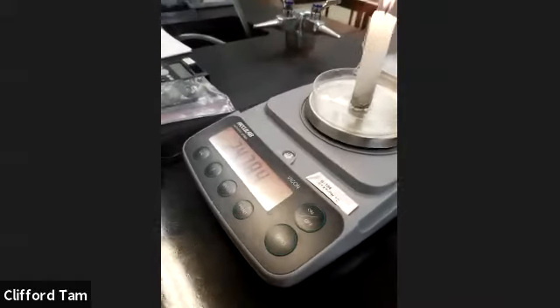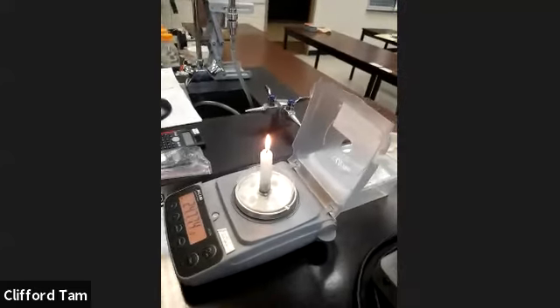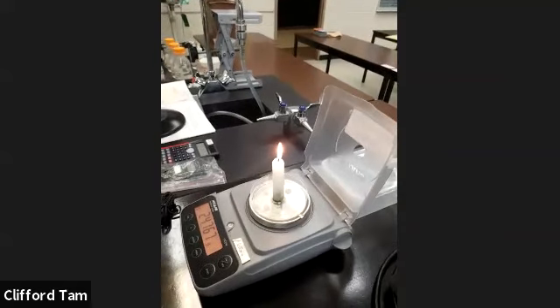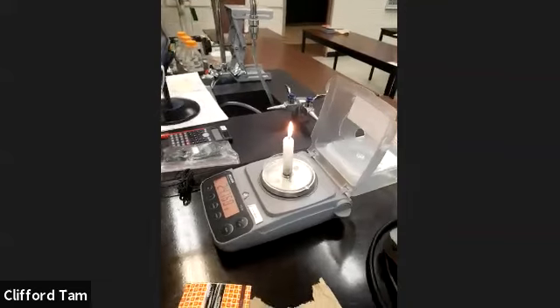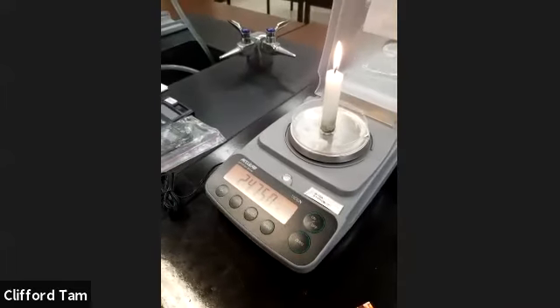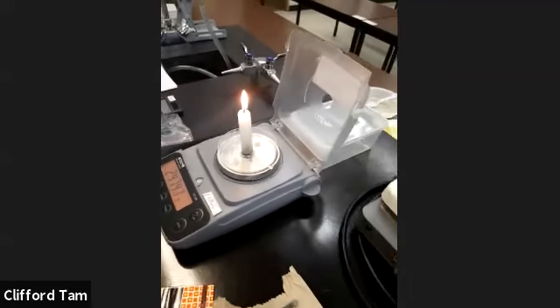And as you guys can see right here, the mass is slowly dropping as the candle is burning. That's because the paraffin, which has a huge molecular formula, C25H52, is being broken down into carbon dioxide and water. Okay? So every 30 seconds or so, we're going to take the mass, for a total of, I think, 300 seconds. Yeah, we go for, I think, 3 minutes, right? Yeah, so that's the idea behind what's happening here.